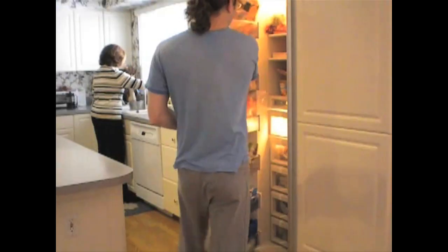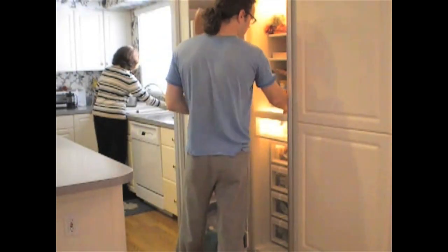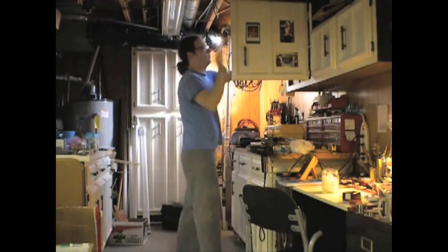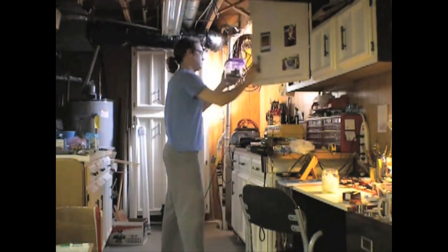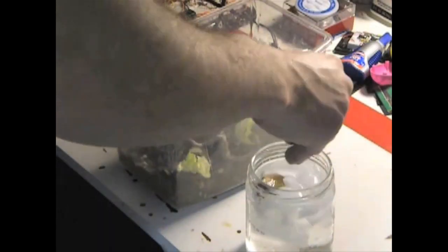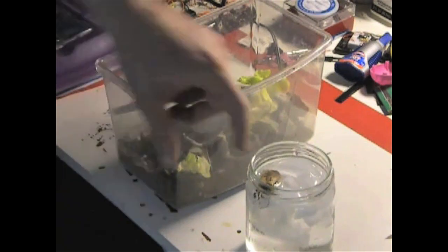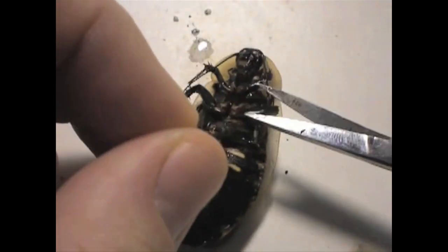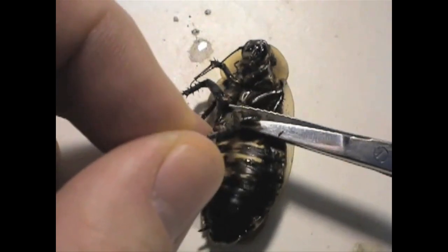Well, Tim and Greg can help you. We present the open-source SpikerBox, where you can inexpensively record from the nervous system of insects. To begin, take some ice from your mother-in-law's refrigerator. Then go downstairs to your basement workshop and grab your cockroaches from their favorite hiding place. Make sure they're alive and healthy. Take one of the good ones and dunk it in the ice water anesthesia. After a few moments, it'll stop moving and we'll be ready for the surgery. Carefully cut off one of its legs. Don't worry, they can grow back.